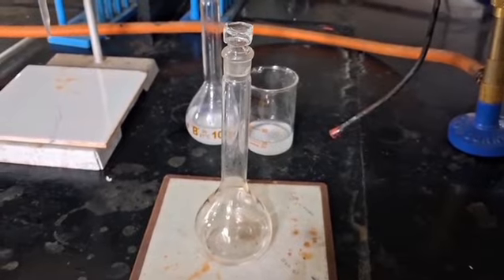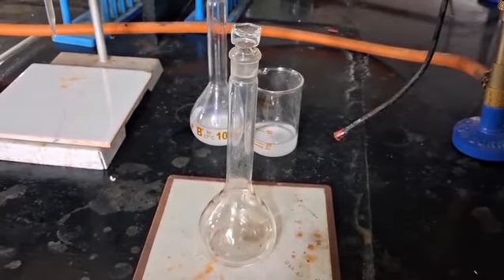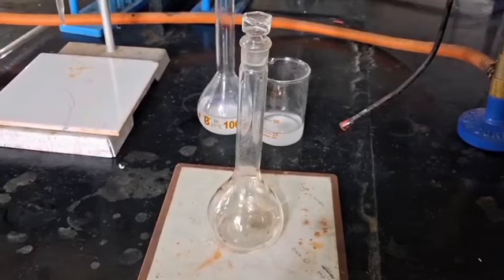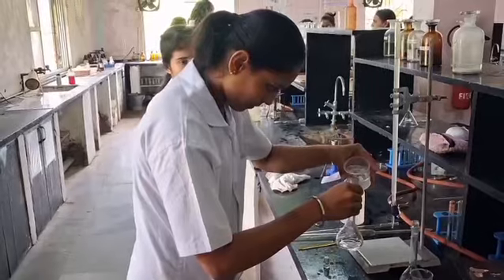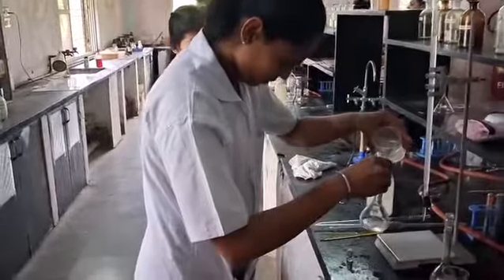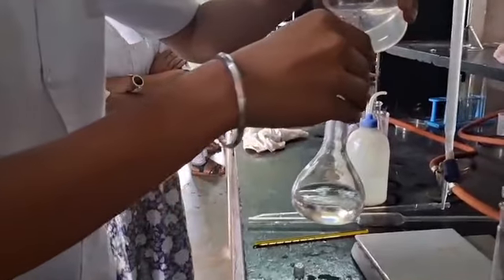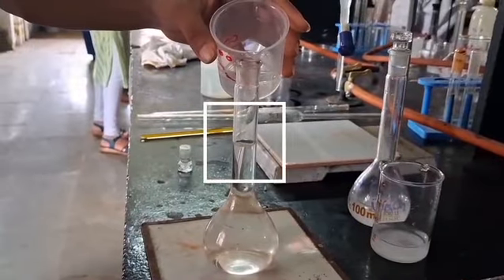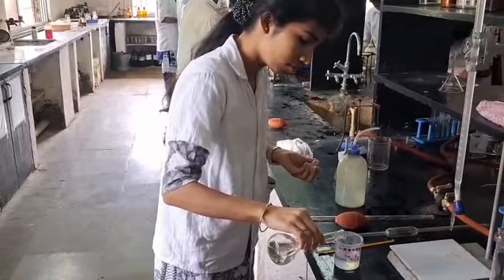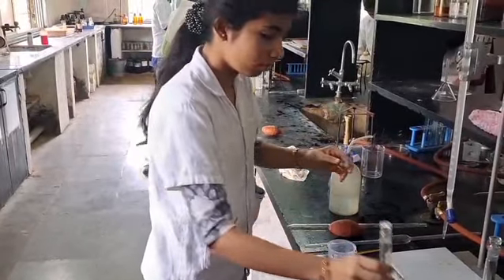Now you are provided with a standard measuring flask bearing your table number containing unknown sample solution of calcium ion. Dilute the sample solution by using distilled water up to the mark. Pipette out 10 cm³ of diluted sample solution in the conical flask.